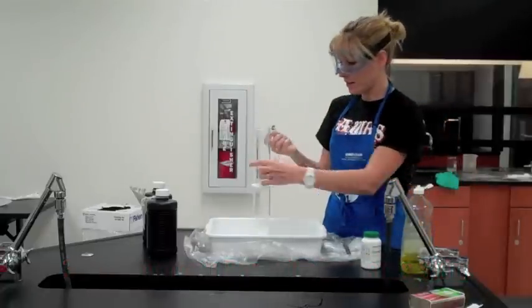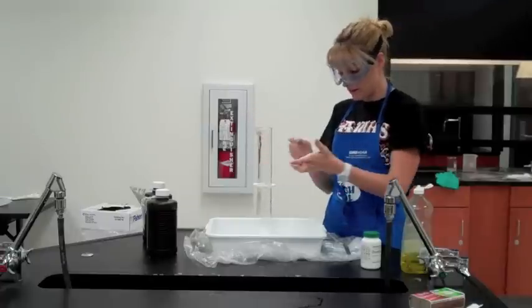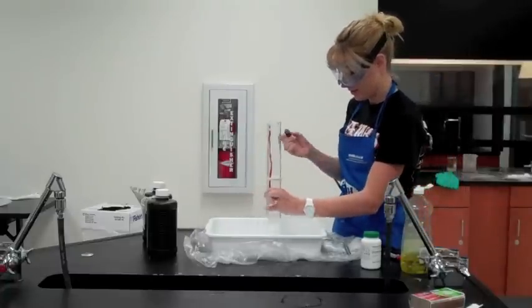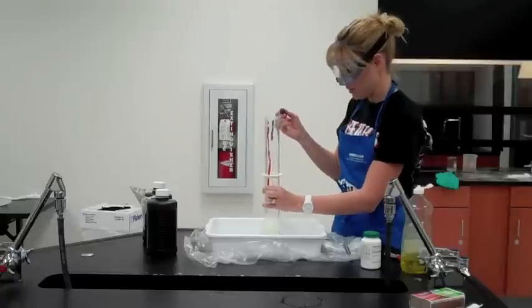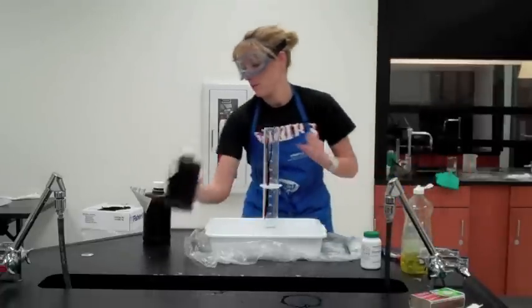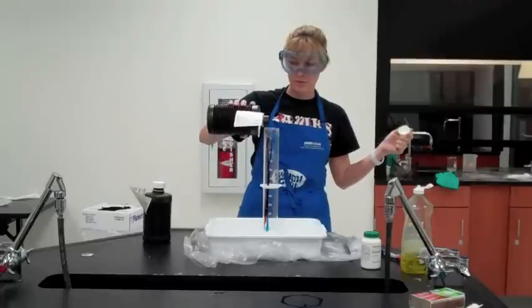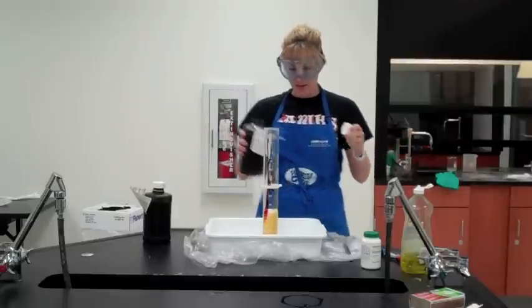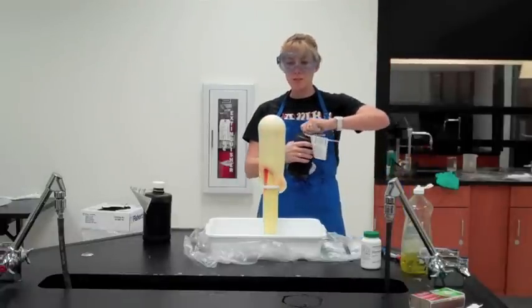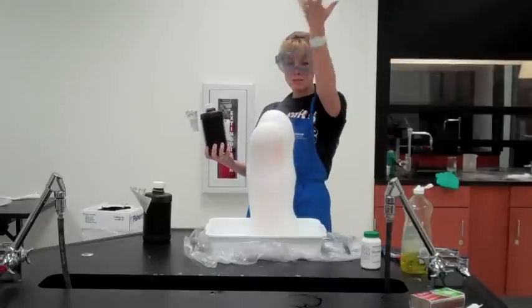Just to make it a little more interesting — Aquafresh is my favorite toothpaste, so I'm going to doctor this up to make it look like Aquafresh. Now just adding in some 30% hydrogen peroxide, not the 3% you get at the grocery store — that wouldn't be potent enough. I wish you could see the steam coming off, because this reaction is actually very exothermic.